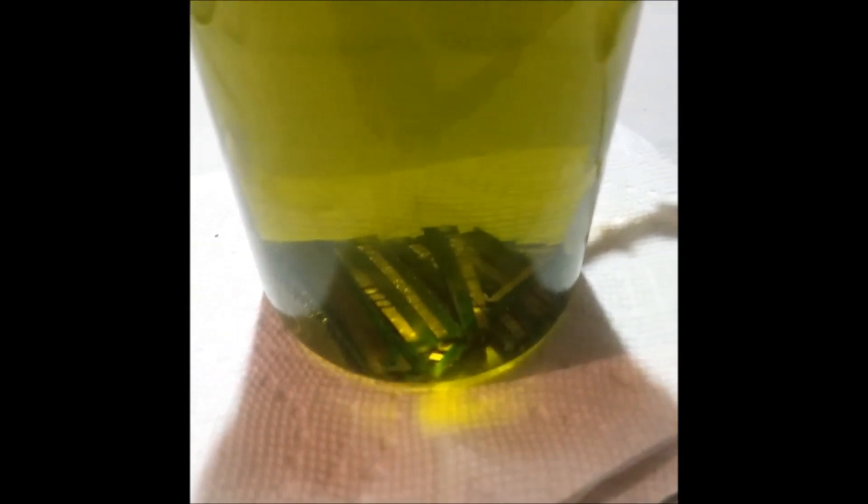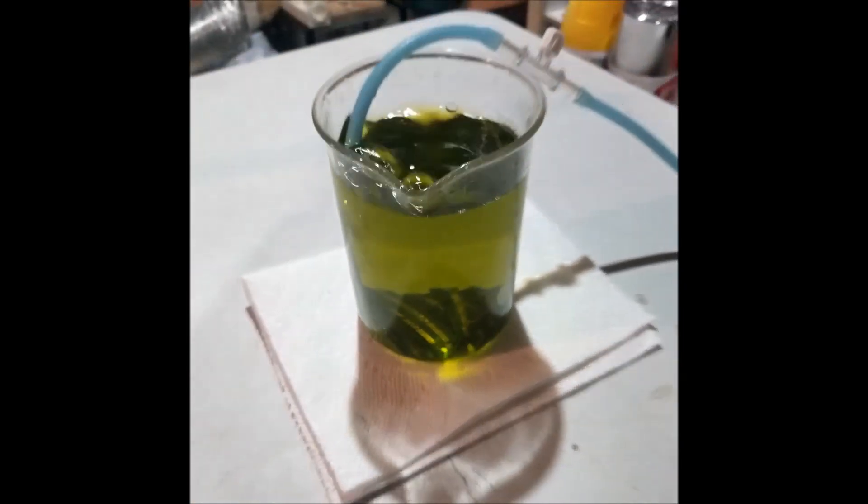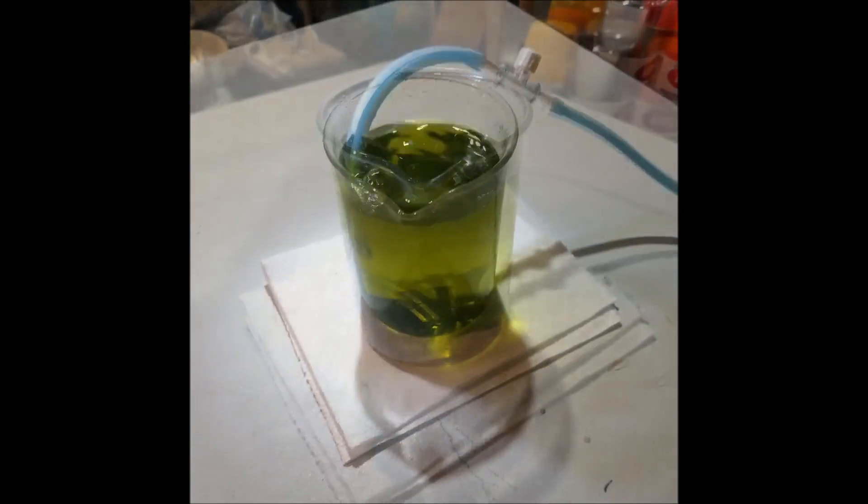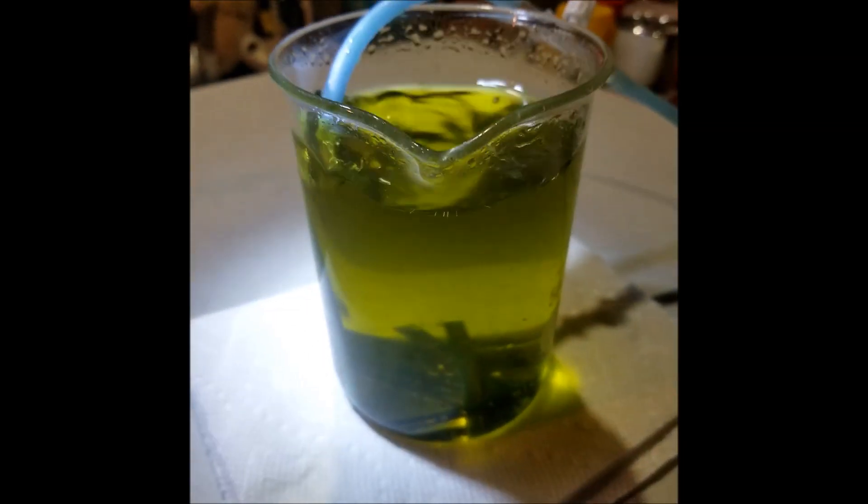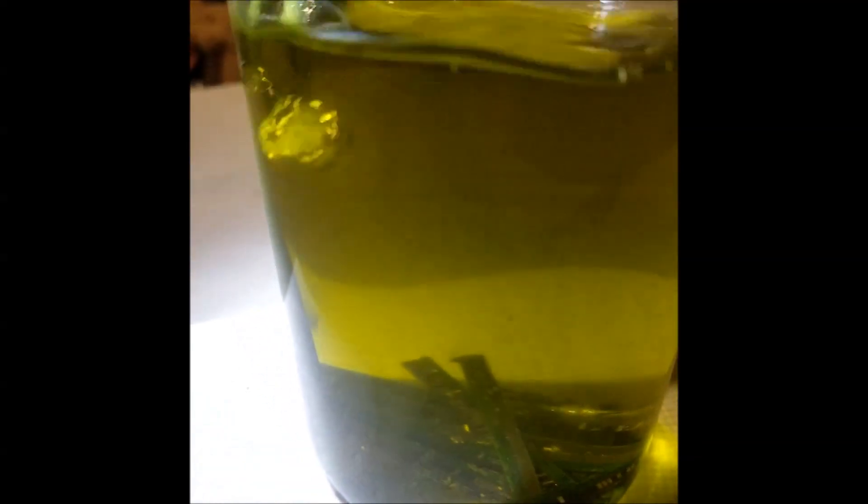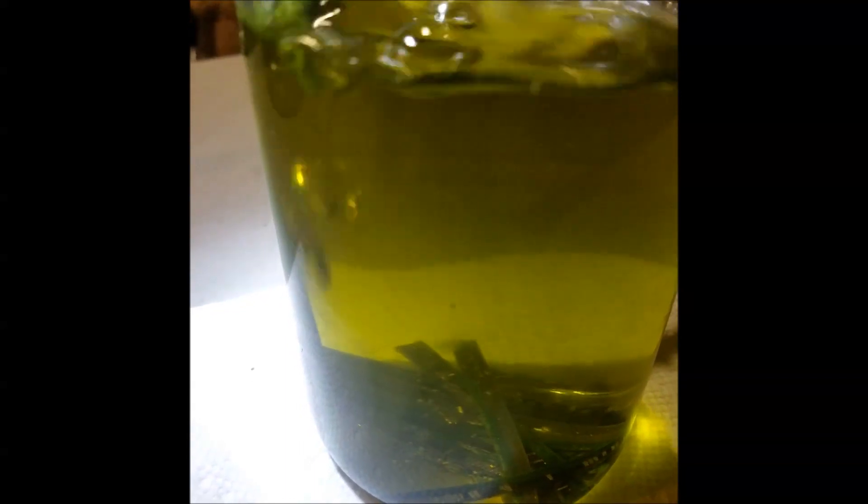You can see there's still gold stuck to those strips, but that should all have happened. Approximately 20 hours later, and you can start to see the gold getting removed and some of it is floating around in the solution there.